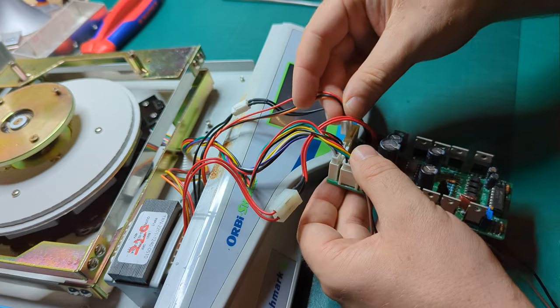Okay, here's the exciting part. I've replaced the transistor, and while it's dark outside, I really want to give it a go just to see if this is the part that makes all the difference. Of course, I'll have to put it together properly, but before I do that, I'm going to test it.